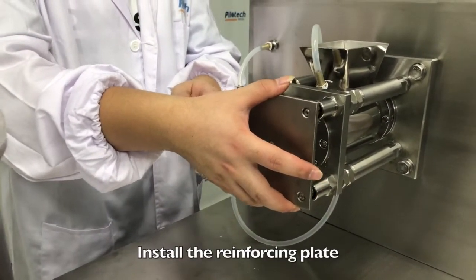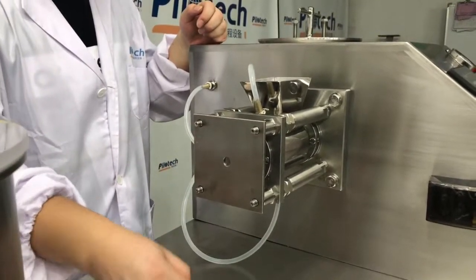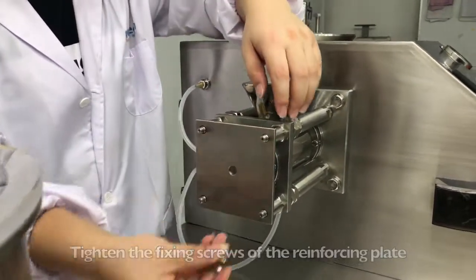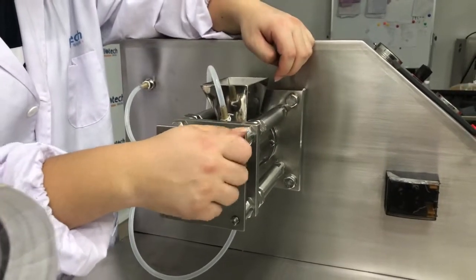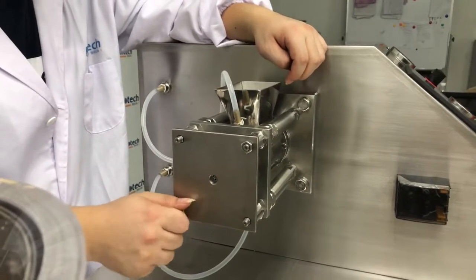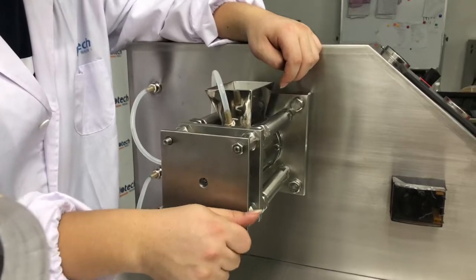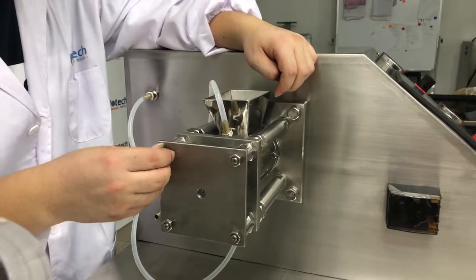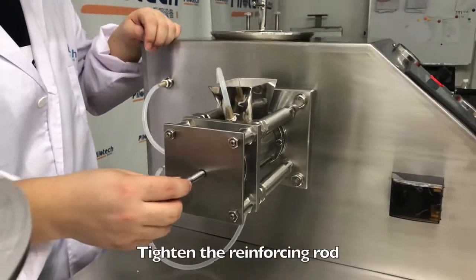Install the reinforcing plate. Tighten the fixing screws of the reinforcing plate.